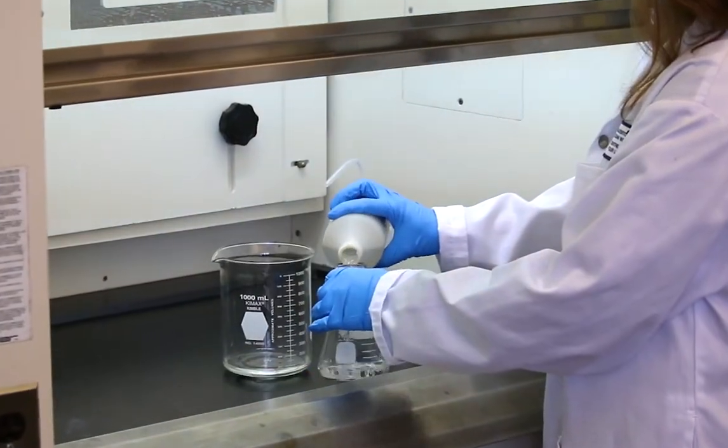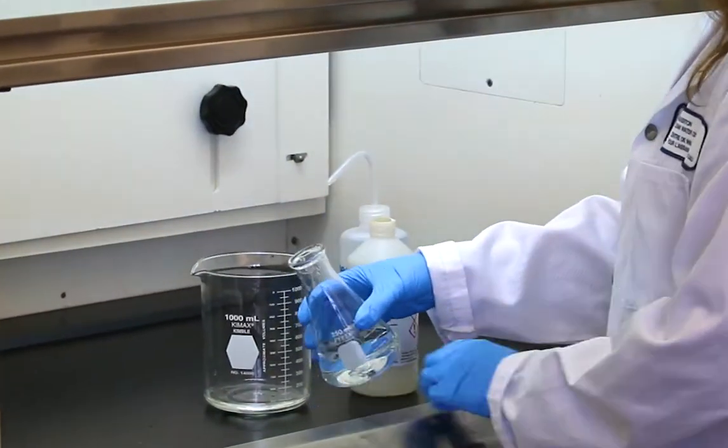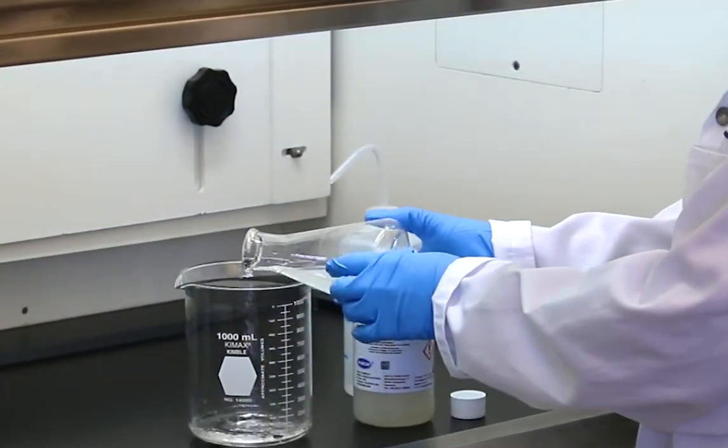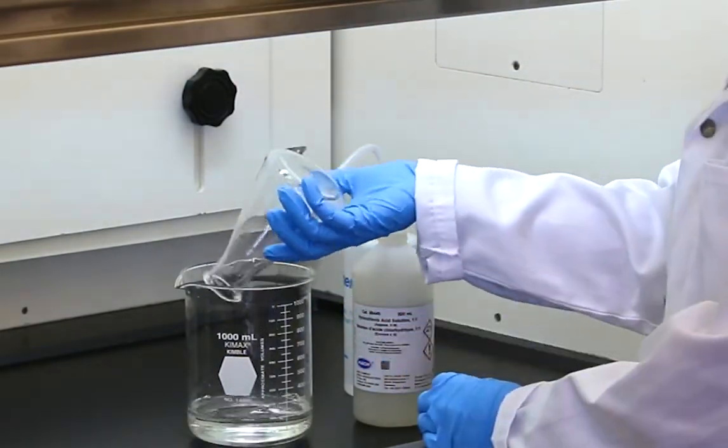Collect water samples in bottles that have been cleaned with 6 normal or 1 to 1 hydrochloric acid and rinsed with deionized water.